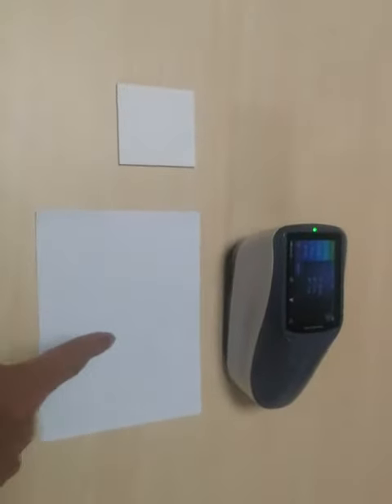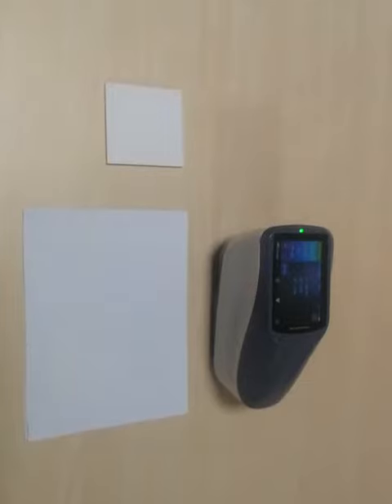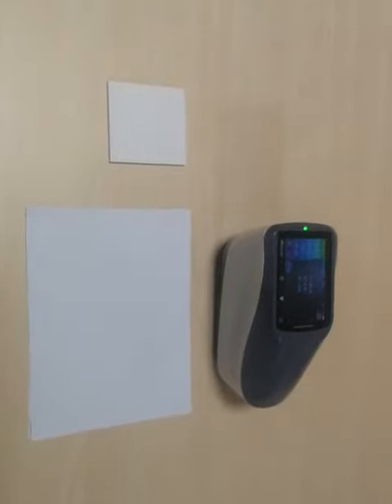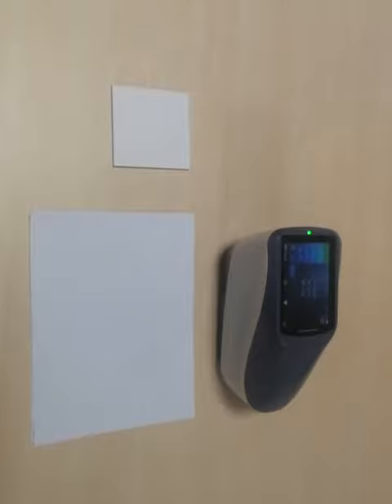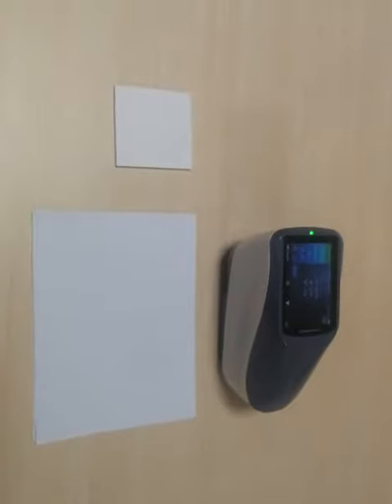Two pieces of paper here. We can see the slight difference between the paper, but we can't know how much the difference is.